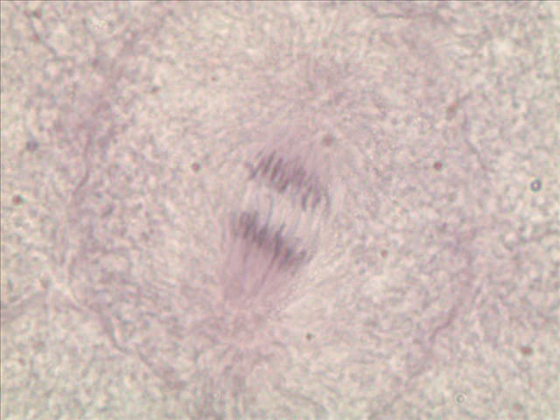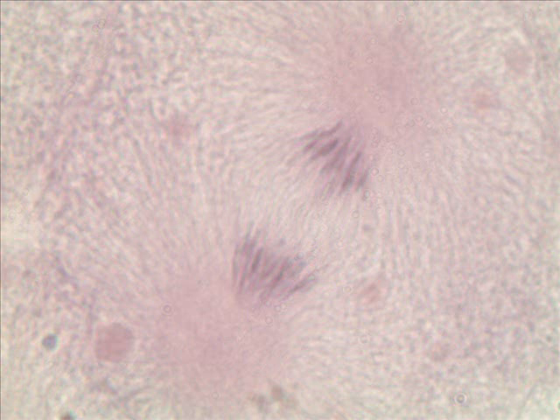Okay, we're a little farther along now in anaphase. And so in anaphase, we've got these unduplicated chromosomes being pulled this way, these others being pulled the opposite direction. Anaphase. And a little farther along in anaphase here, again, the unduplicated chromosomes being pulled to opposite ends of the parent cell. And this would be probably very late anaphase.